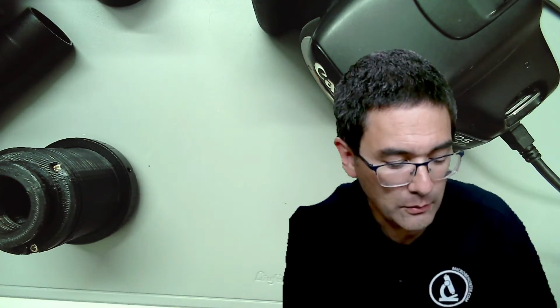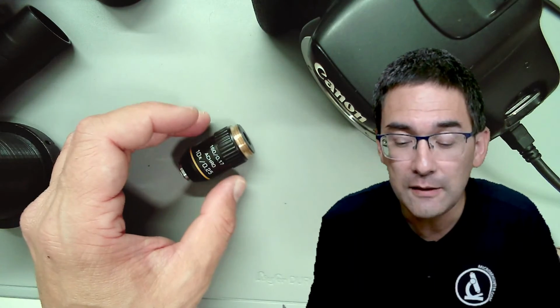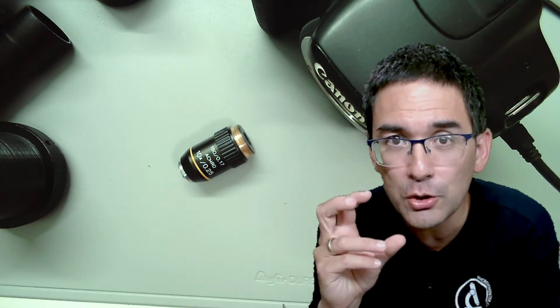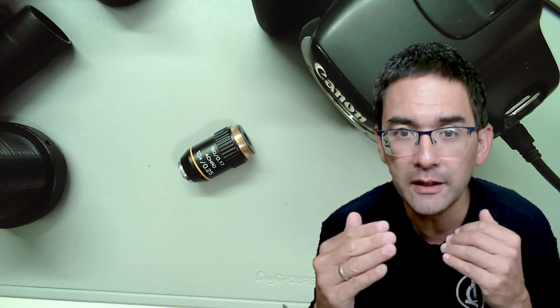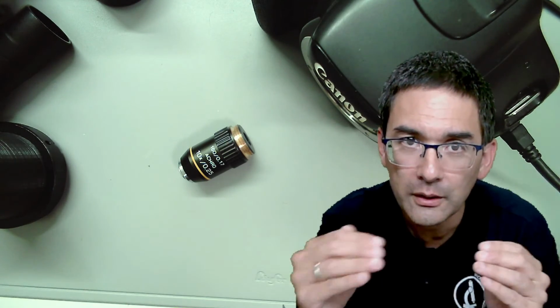It's like this: optics lenses essentially are not perfect. It has to do with the physics. If you take a simple convex lens and try to make a picture with it, the image quality is going to be fuzzy. At the corners between light and dark, there are going to be purple and yellow fringes.